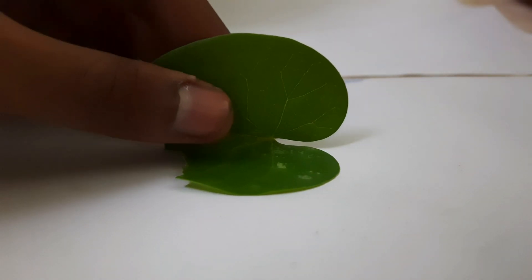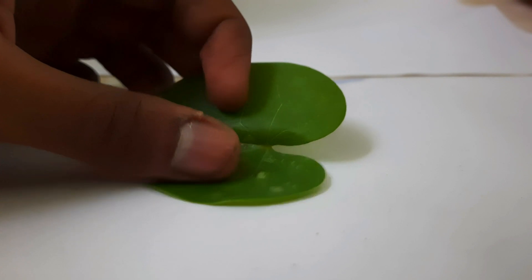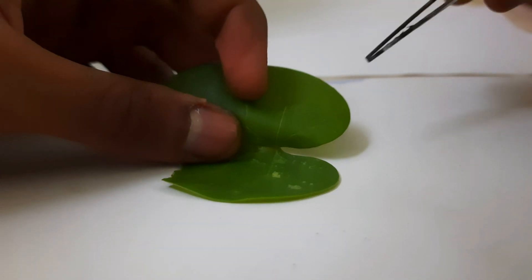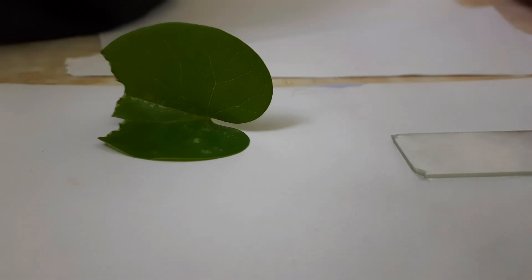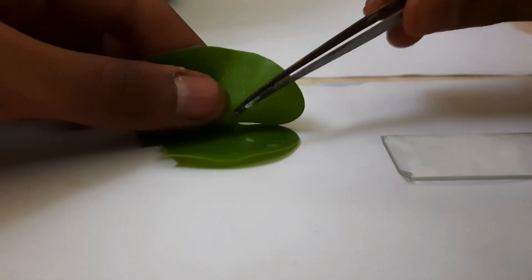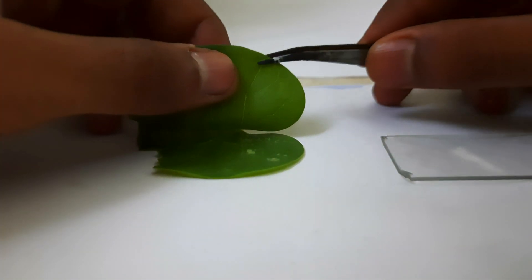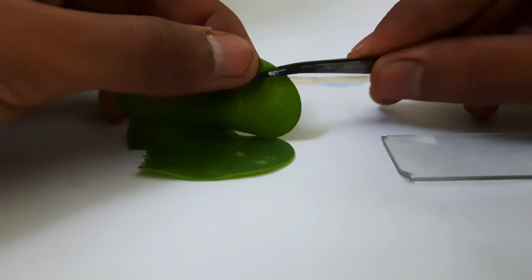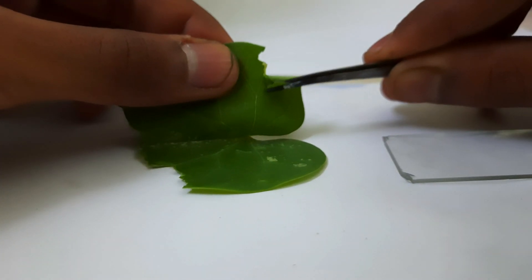I just got set with a leaf over A4 size paper for a better view. As you know, we can't view the leaf directly down the microscope because we'd just end up viewing dark green colored structures which are pretty much unclear. So we need to peel off a transparent layer so that we'll just be viewing the transparent cells down the microscope.